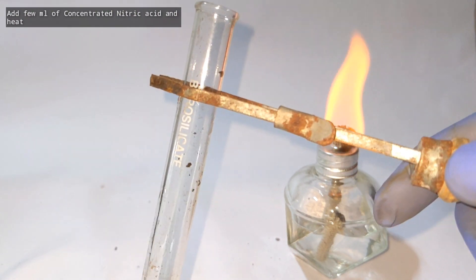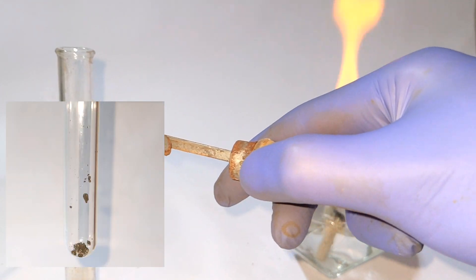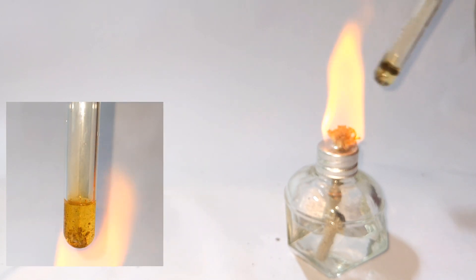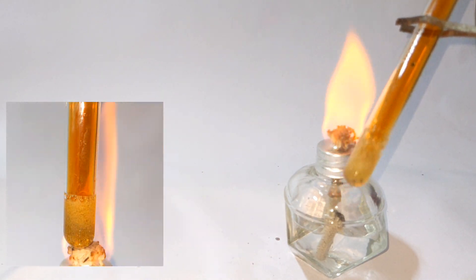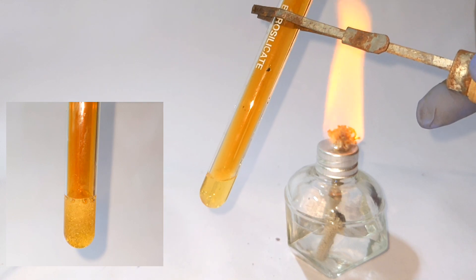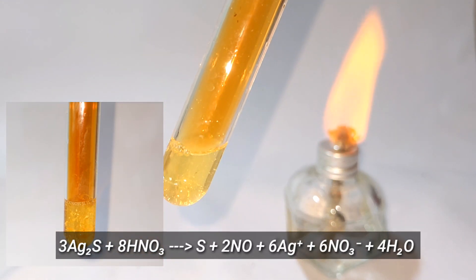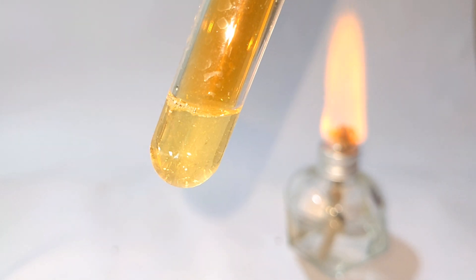The precipitate of silver sulfide is taken in a test tube and a few milliliters of concentrated nitric acid are added, then the test tube is heated on a flame. Hot concentrated nitric acid decomposes the silver sulfide, and sulfur remains in the form of a white precipitate. You will see the evolution of nitrogen dioxide gas in this reaction. After the reaction you can see that there is no more black precipitate of silver sulfide, as everything got decomposed.